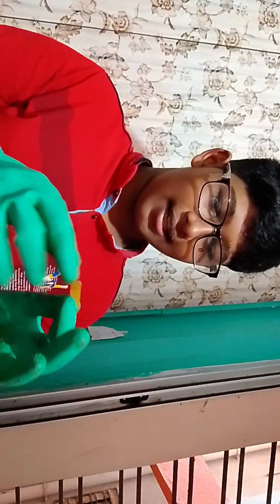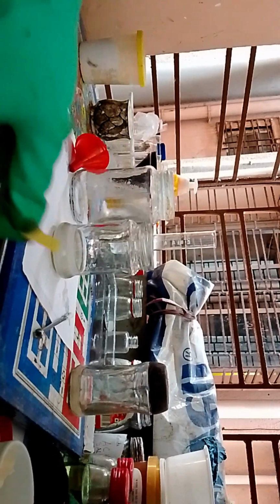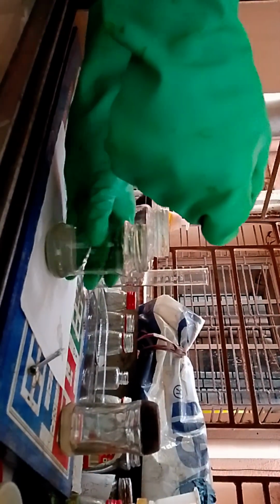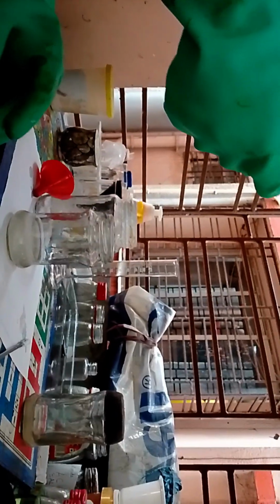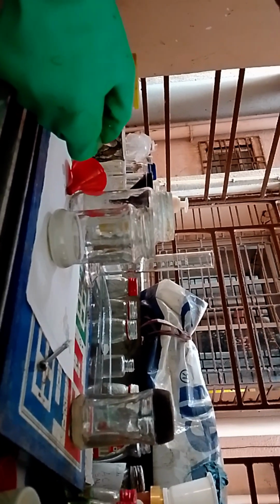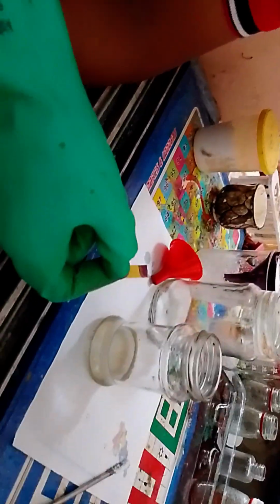That smells like nothing. Paper. Okay, I've got my pH paper. I think you have seen the footage. I was smelling it, trying to find out what it was made of, and we need to wait for a moment because it first appeared to be purplish, then it is getting red. We are getting a rainbow.